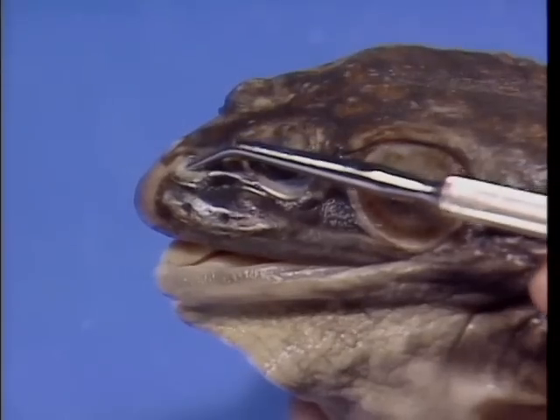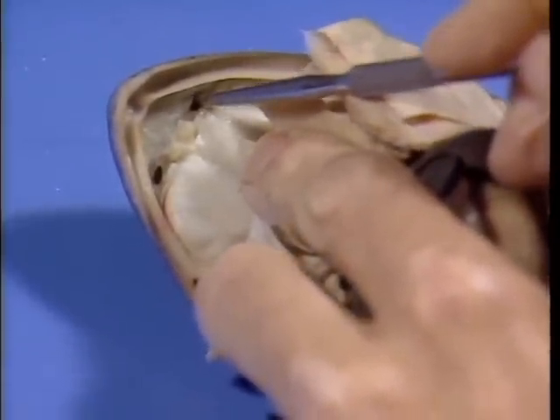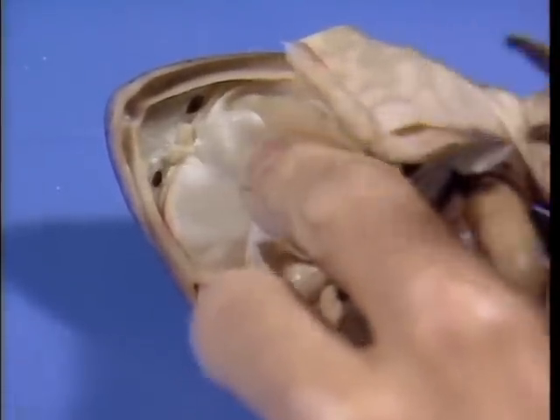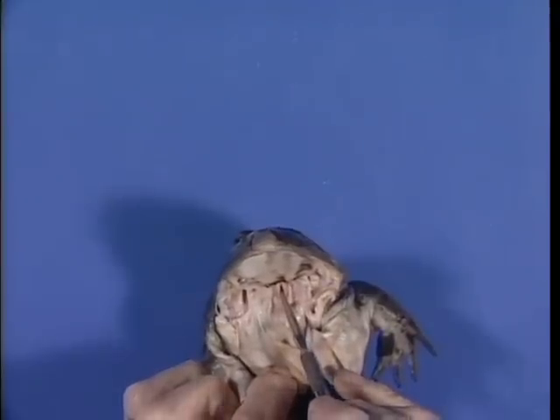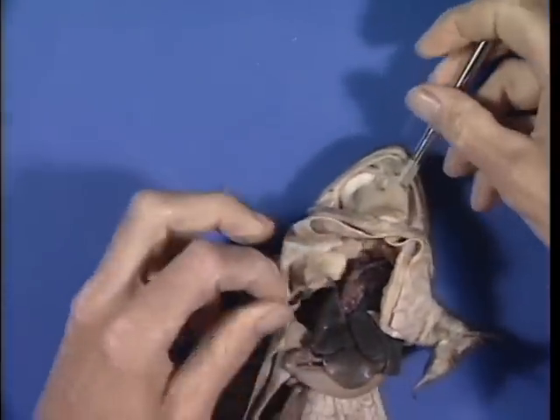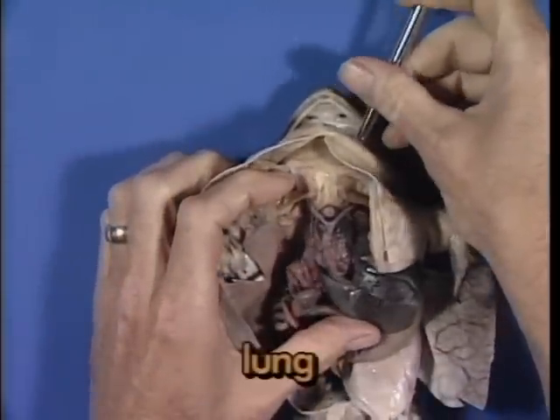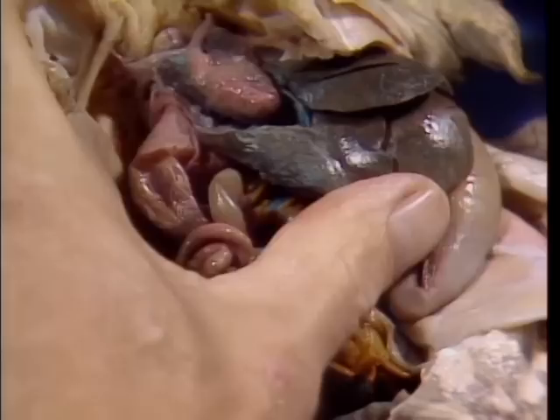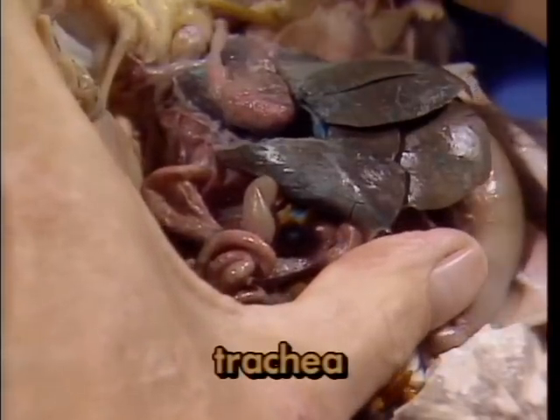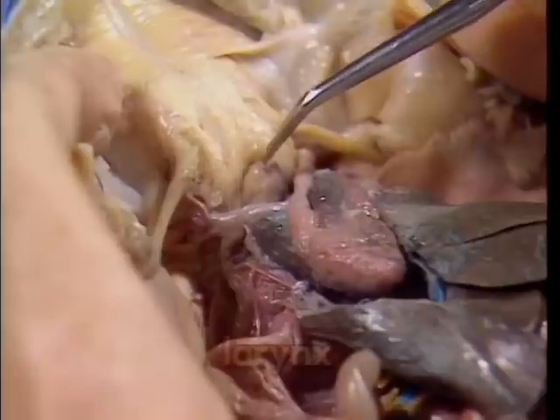Air enters through the external nares, here and here. It then empties into the mouth cavity through the internal nares, here and here. Next, air enters the glottis, at the rear of the mouth here. The blunt probe is inserted through the glottis in the floor of the throat, verifying that it connects to the lung. Air that is breathed in or inspired passes from the glottis to the trachea. The trachea is not seen here, as it lies just dorsal to the larynx, seen here.